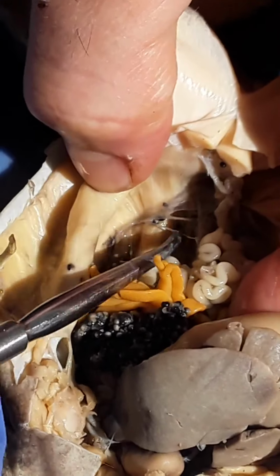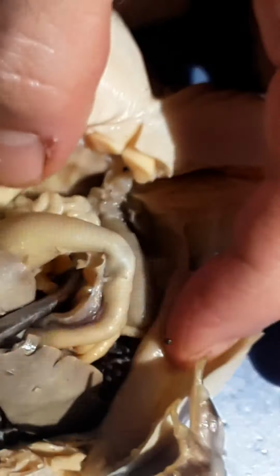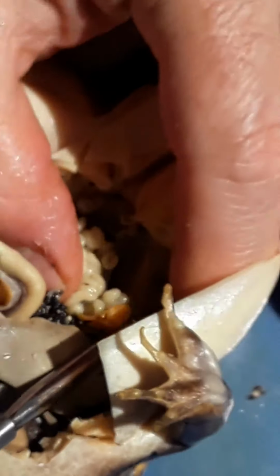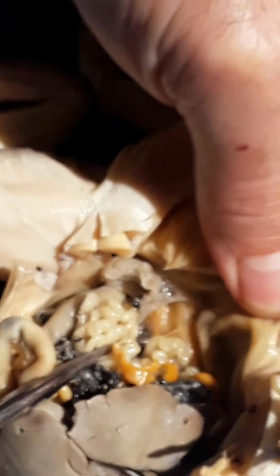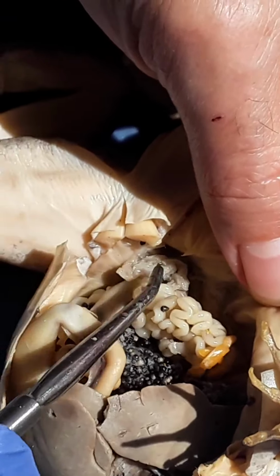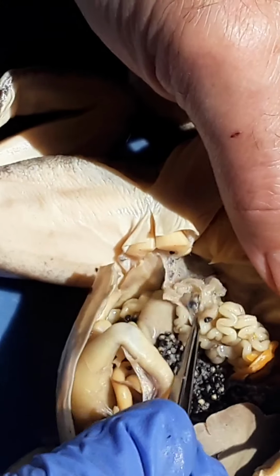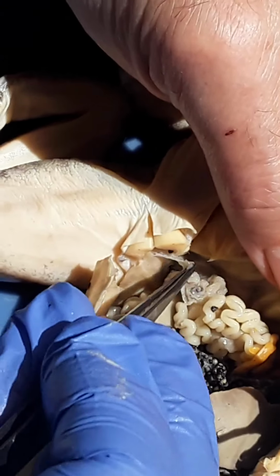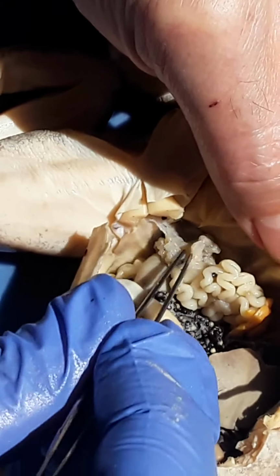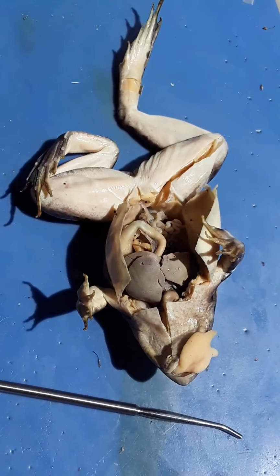Again, it's outside of the body cavity, down in here. You can see it better over here. Kidneys down in here. And in fact, in this specimen, you can see the urinary bladder fairly well. Very elastic. Again, form equals function. It's an elastic expandable pouch, right? Leads through the cloaca. And that's the frog.